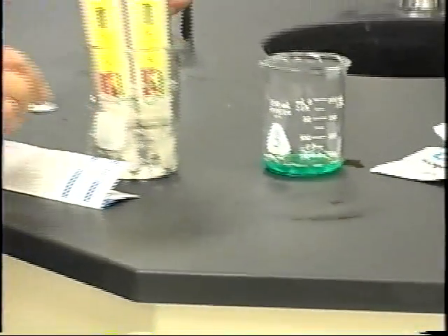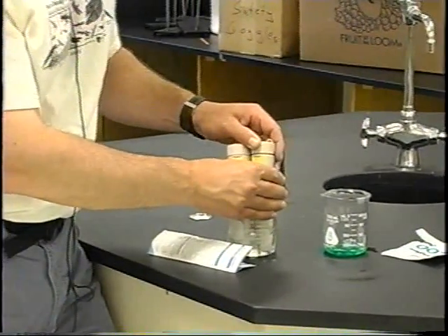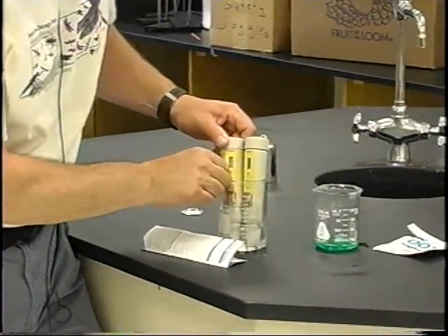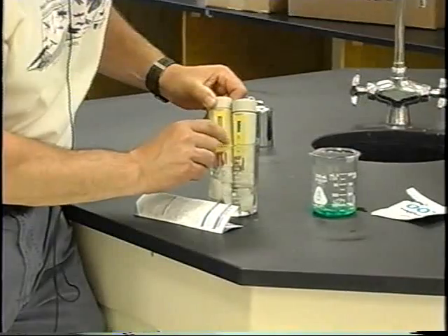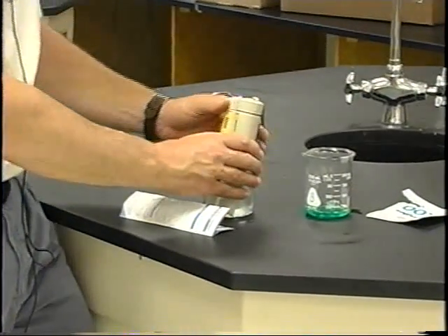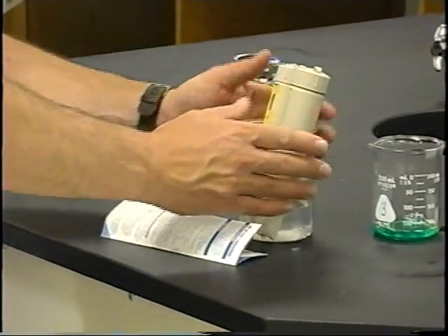And it says the first thing you want to do is turn these on. And I have calibrated them earlier, but I'm going to do it again and repeat it for you. So you turn these on, and they have little on-off switches, little buttons that you press there. Got to make sure that one's on. There we go. They're both on.